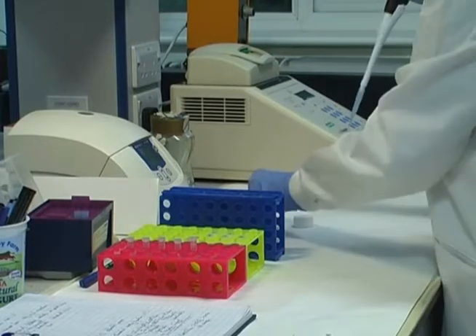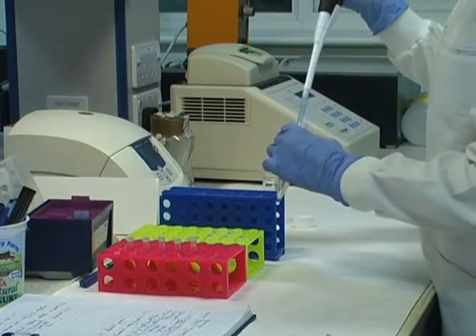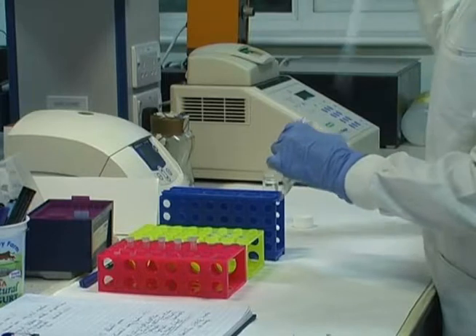Adding the sterile water will allow us to extract the DNA from the swab using a commercially available DNA extraction kit and once complete will provide us with our sample DNA to perform PCR analysis upon.